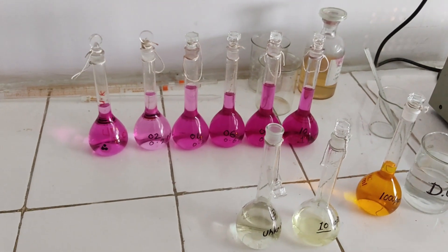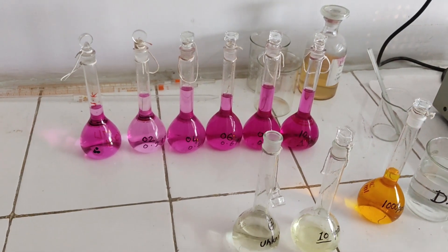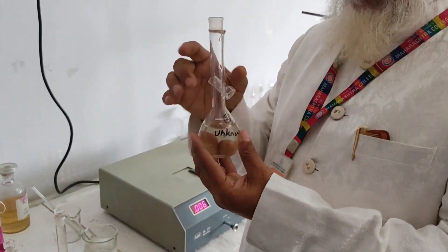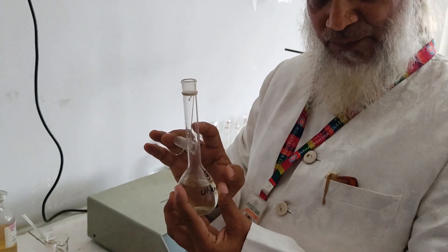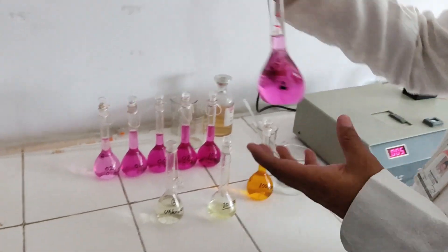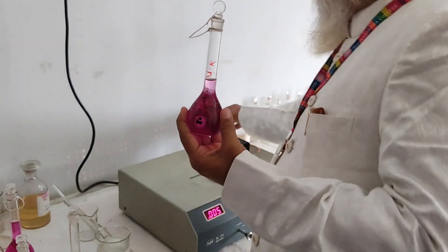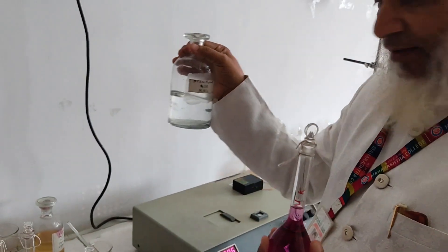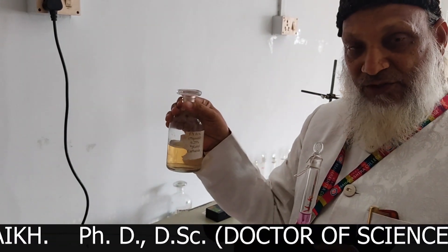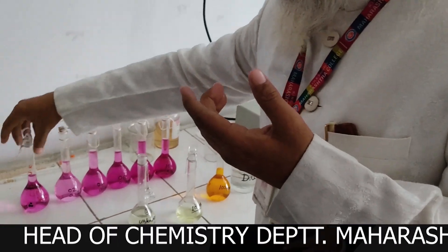You can see that as the concentration is increasing, the color intensity is also increasing. An unknown water sample will be given to us. Dilute it to 100 cm³, take out 10 cm³, add 10 cm³ of 1 molar sulfuric acid, add 2 cm³ of 0.25% diphenyl carbazide, and dilute to 100 cm³. Now we will take the readings.